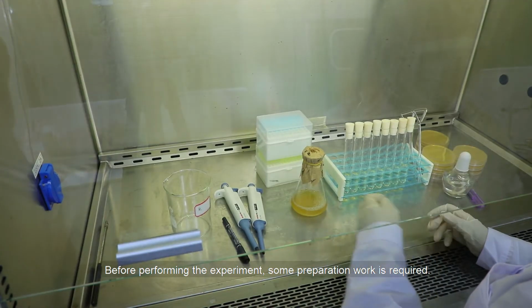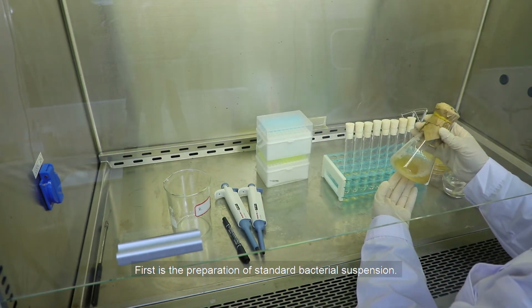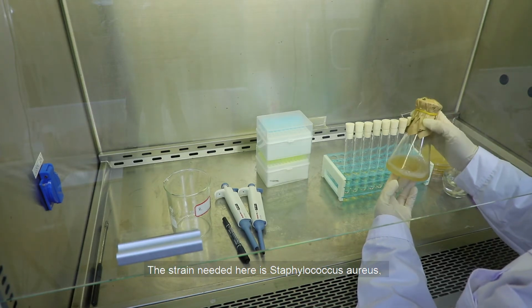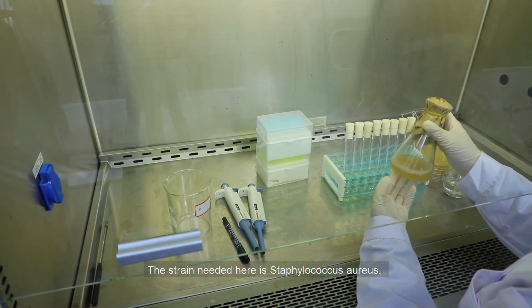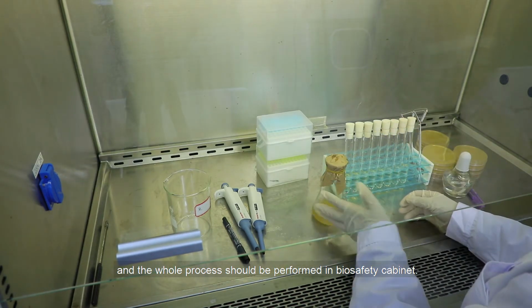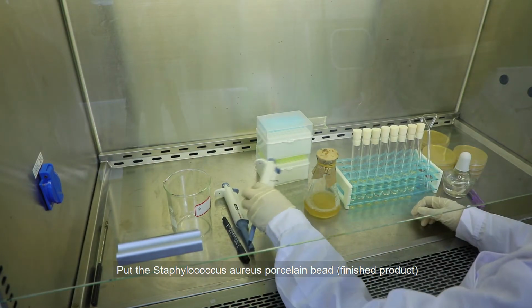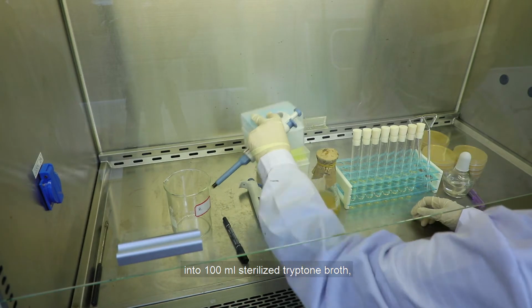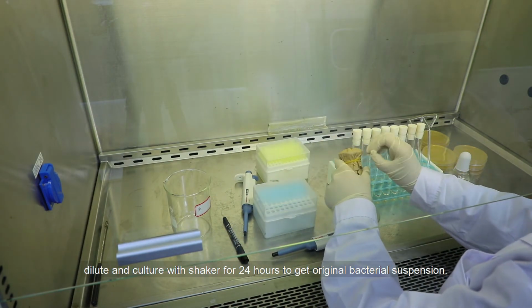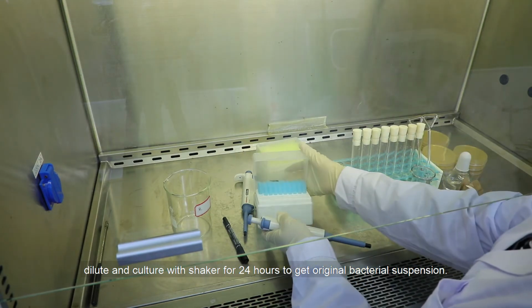Before performing the experiment, some preparation work is required. First is the preparation of standard bacterial suspension. The strain needed here is Staphylococcus aureus, and the whole process should be performed in a biosafety cabinet. Put the Staphylococcus aureus porcelain bead, finished product, into 100 mL of sterilized tryptone broth. Dilute and culture with a shaker for 24 hours to get the original bacterial suspension.